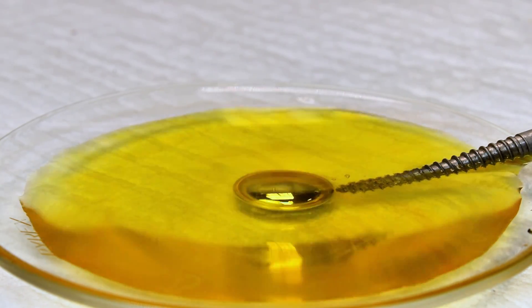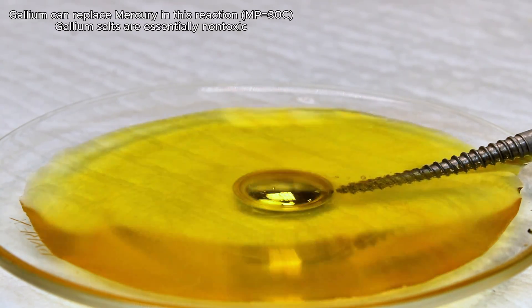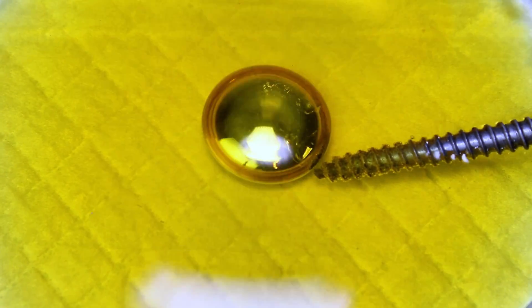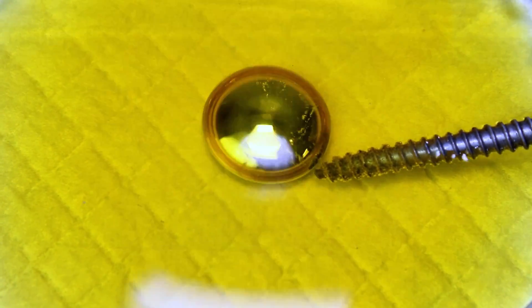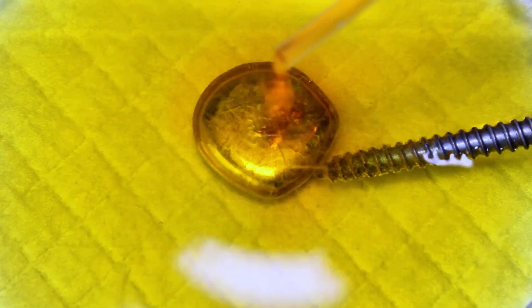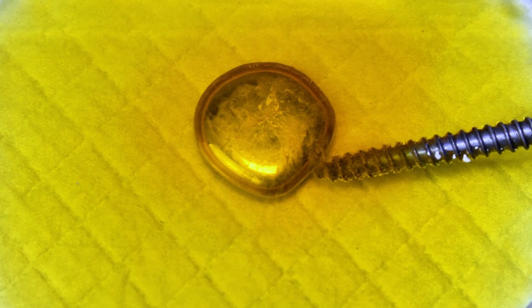To make this all a whole lot safer, gallium can be used in place of mercury — you just may need to melt it with some warm water first. Gallium performs nearly the same, but the lower surface tension of gallium means you might get a less symmetrical shape. Potassium dichromate can also be replaced by any number of oxidizing agents, but unfortunately none of them work nearly as well.